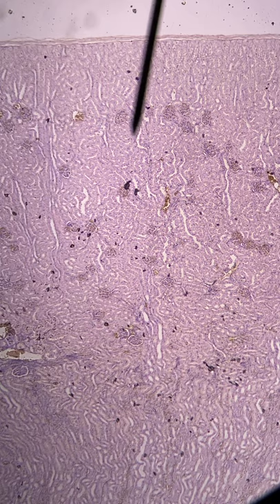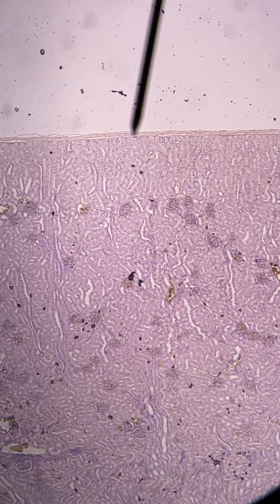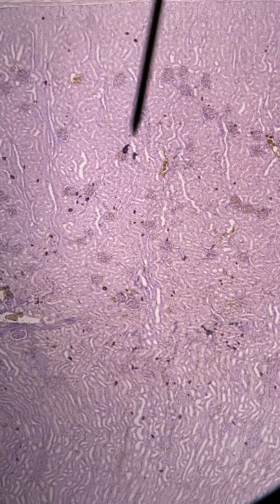Out here, you can see at the tip of that pointer — that's going to be the outside of the kidney. That's the fibrous capsule. Then this whole region we're running through right here is the cortex. And you can see these little spots in there, here and there in that cortex, and I can point at one right here.